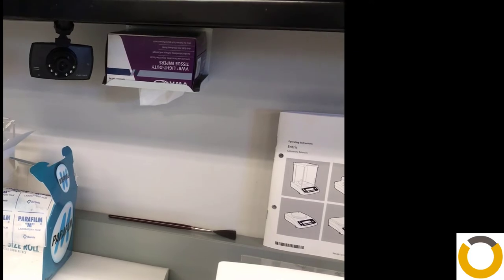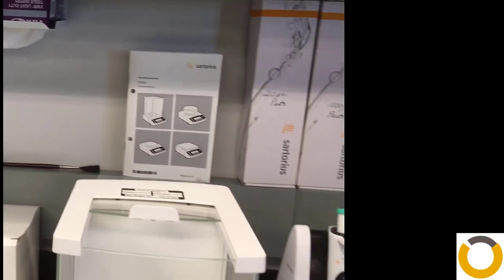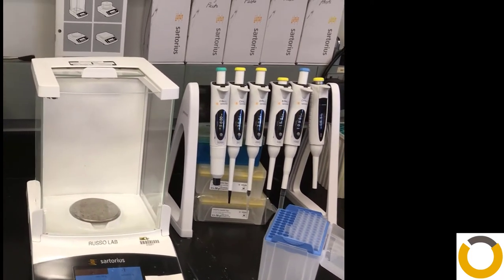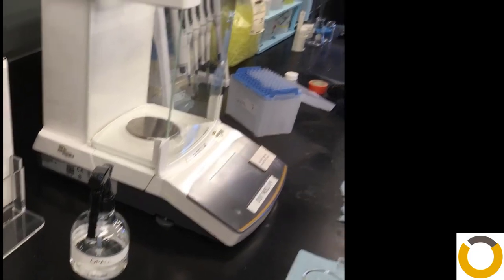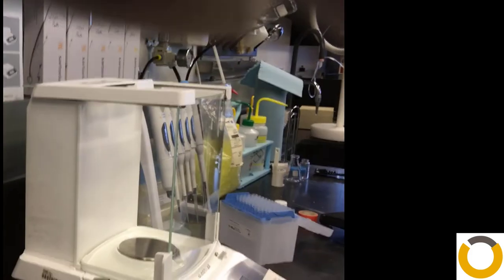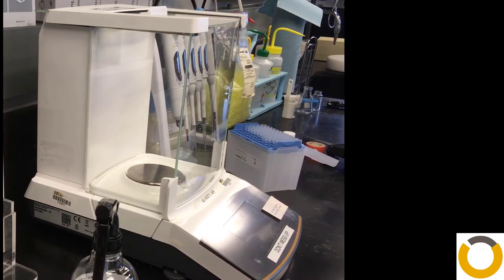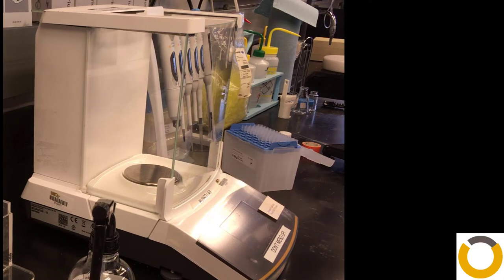One reason for that is that when you're using it, it has this motion-detected camera. And you're recorded, not what you say, just what you do, just your presence. We check that, and if something goes wrong, we can find out what went wrong. So let me go ahead and set this up, and we'll walk through this. What we're going to do is just make a simple tare and read.